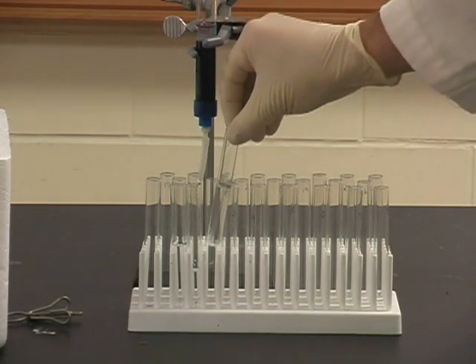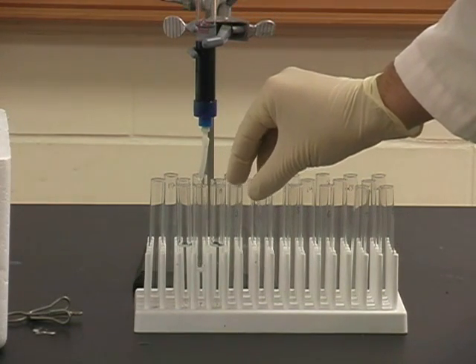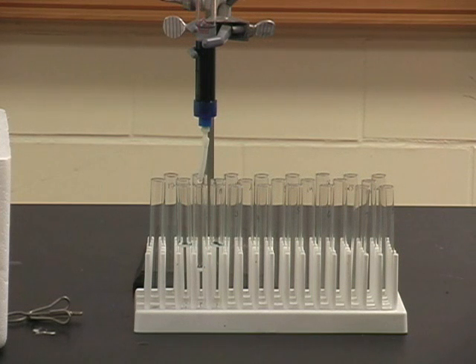In this case you'll be using either two and a half or three milliliters. As sample drips into the tube, you can compare the sample volume in your tube to the sample volume in the reference tubes. This will allow you to estimate the amount of sample that you have collected. This will be important for constructing your graph later on.